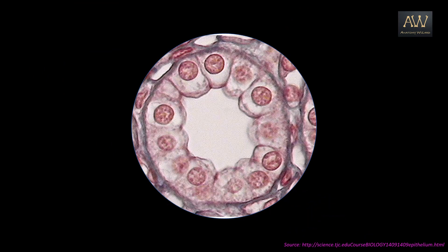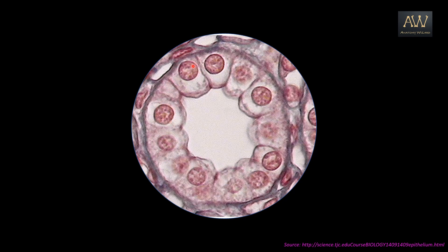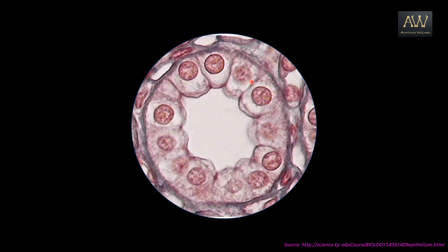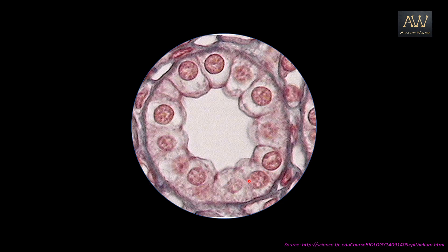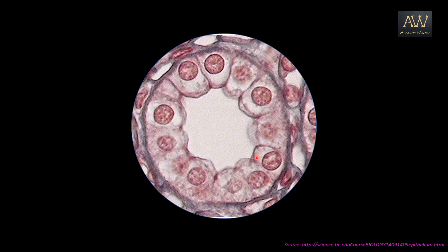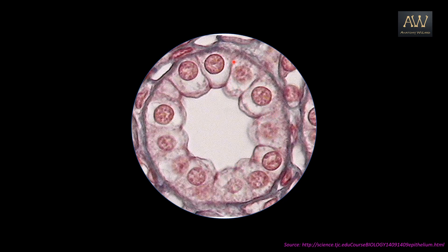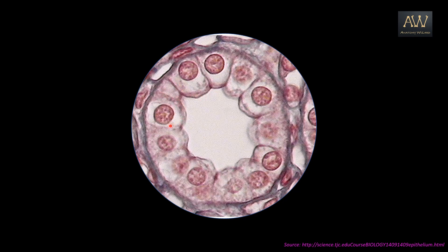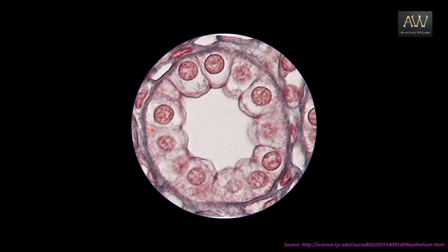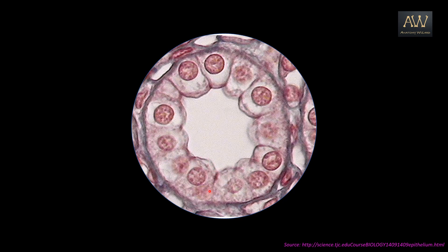Cuboidal epithelium is relatively easier to identify, and that is because of the spherical nuclei which are mostly centrally located. In this slide, you can even see the outlines of the cells which appear rather cubical. So this is probably the duct of a small exocrine gland, and it is lined by a simple cuboidal epithelium.